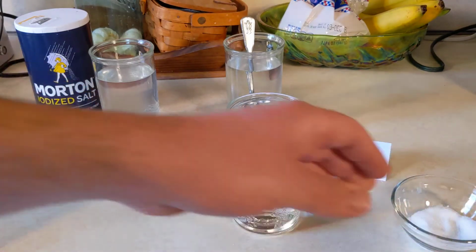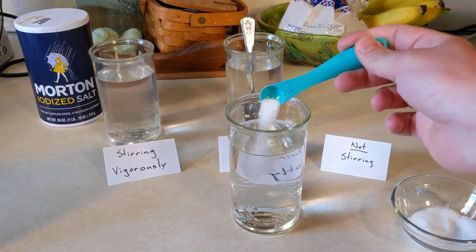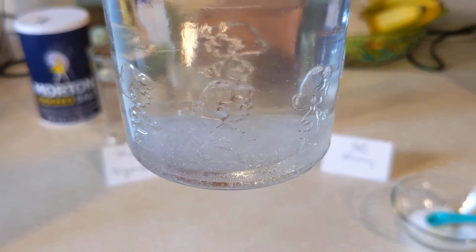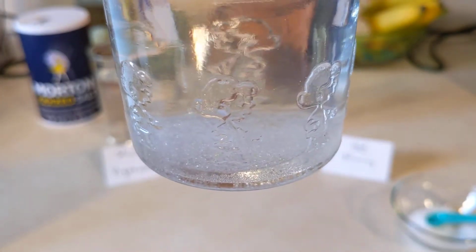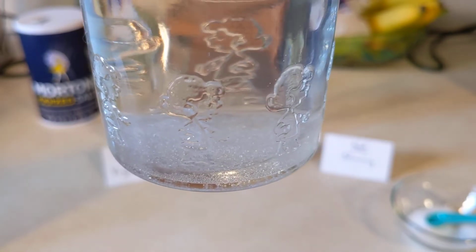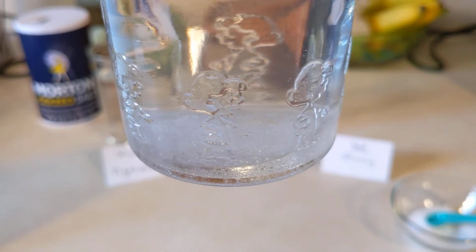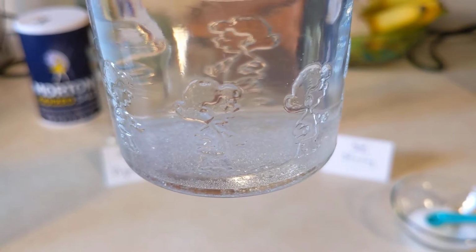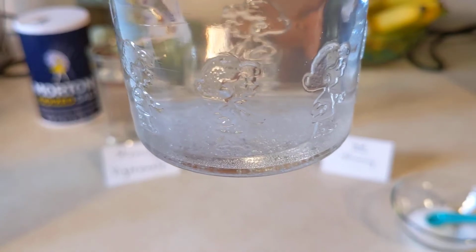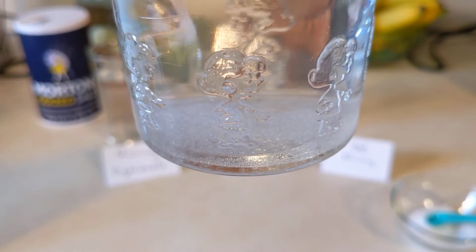Okay, I won't need the stirring spoon for this because we're not stirring it. So we'll start the timer now. Okay, so I'm just going to let this sit there until it all dissolves. Once this is closer to being finished, I'll put in the comments and the video description what time you can skip to, because you don't really want to sit here for 5 minutes and watch this dissolve. I mean, that's what real science is like, but it kind of sucks. So I'll just let you skip that part.